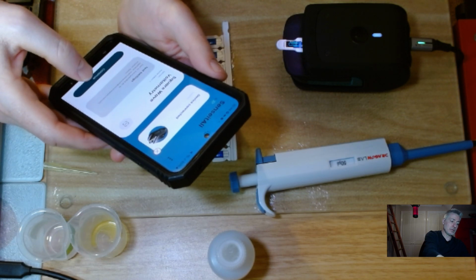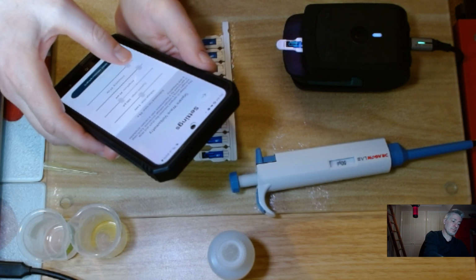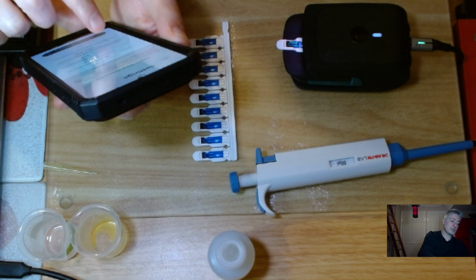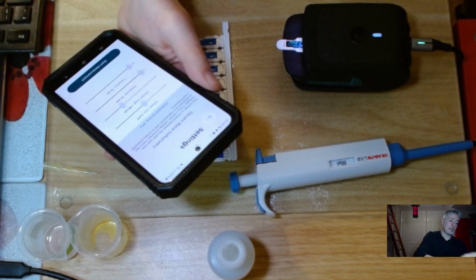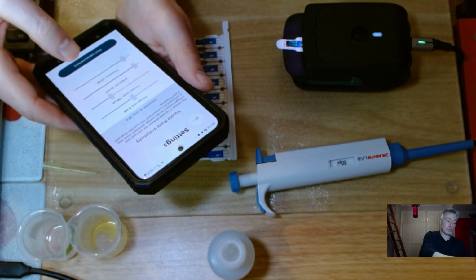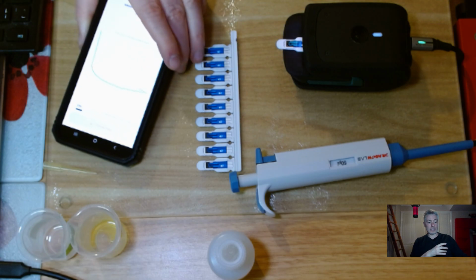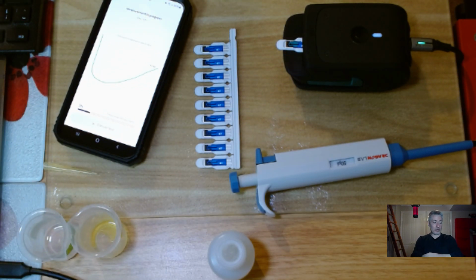I'll go to my settings and get my frequency up to 25 hertz. Now I'm going to do exactly the same experiment, but at 25 hertz. At the end of this, I'll overlay all my data so that you can see the impact of frequency on the signal. I've done 5 hertz already, but because the frequency was low, it took a little bit longer, so I didn't want to record that one. I'll do 25 hertz, then probably 50 hertz, then 100, and then 200.